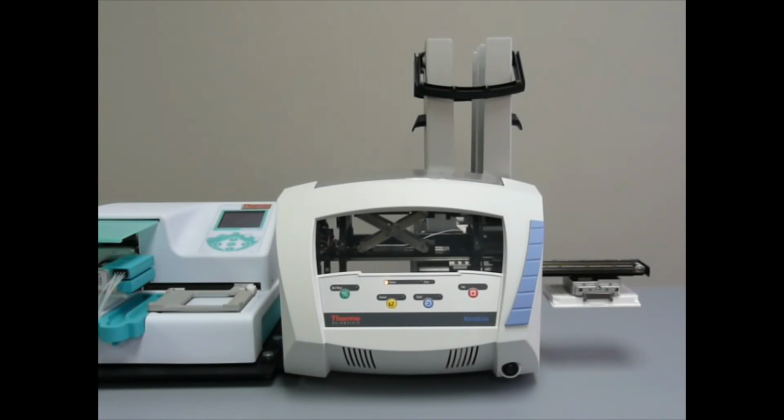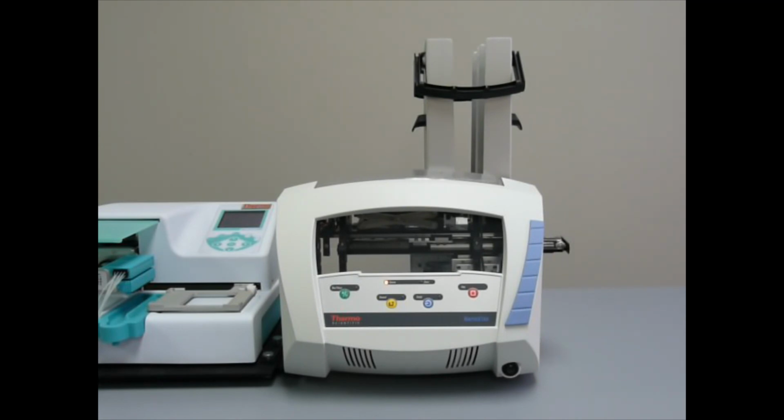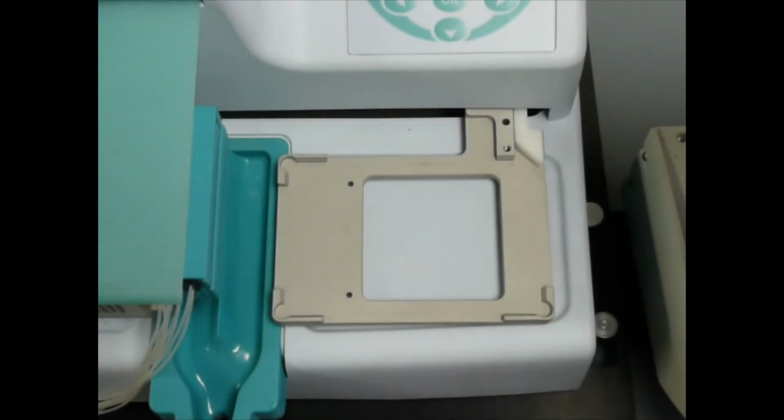You can see how you could make small, very precise movements with the RapidStak Teach tool. Next, we will store this plate. And that's our overview of the RapidStak Teach tool.